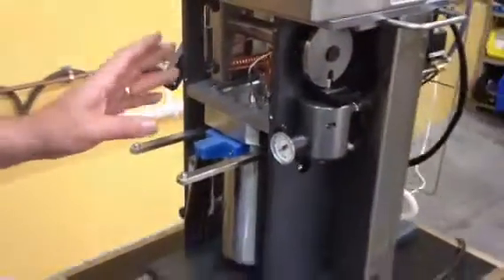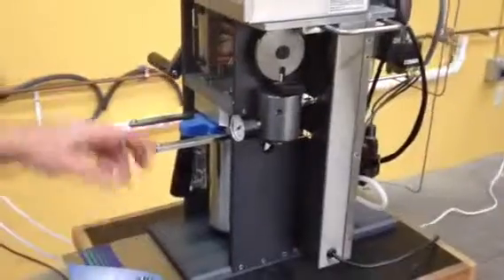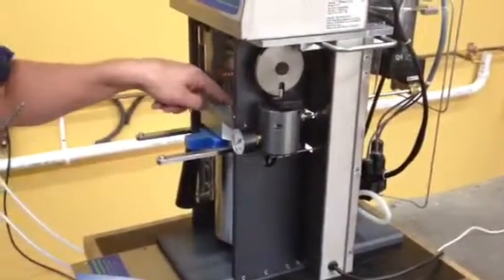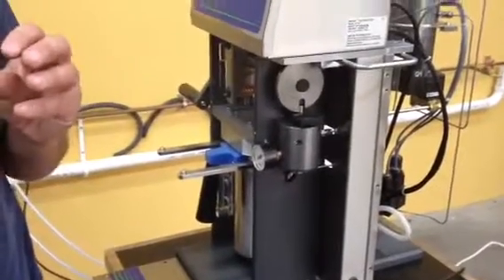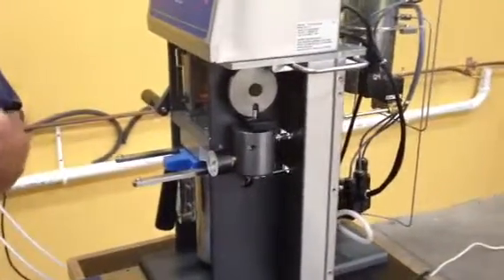Again, there's a Teflon ferrule in there, so you might think it's loose. Just check, see if there's any fat buildup around in there. If these are leaking, it tends to leak the fat out with the solvent, and it kind of gives you a buildup of fat.